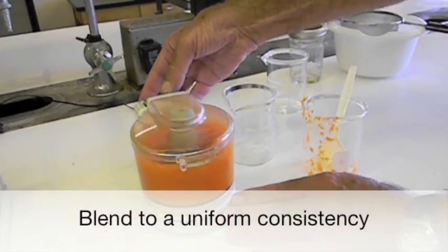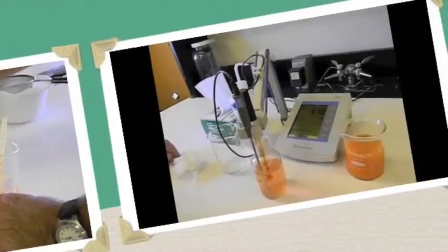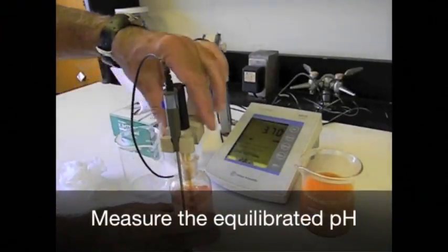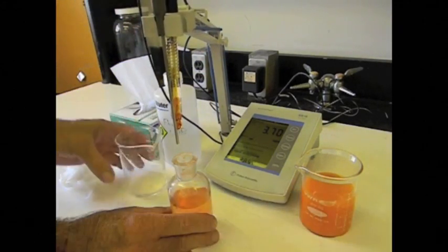Blend to a uniform consistency. We are now ready to measure the equilibrated pH.